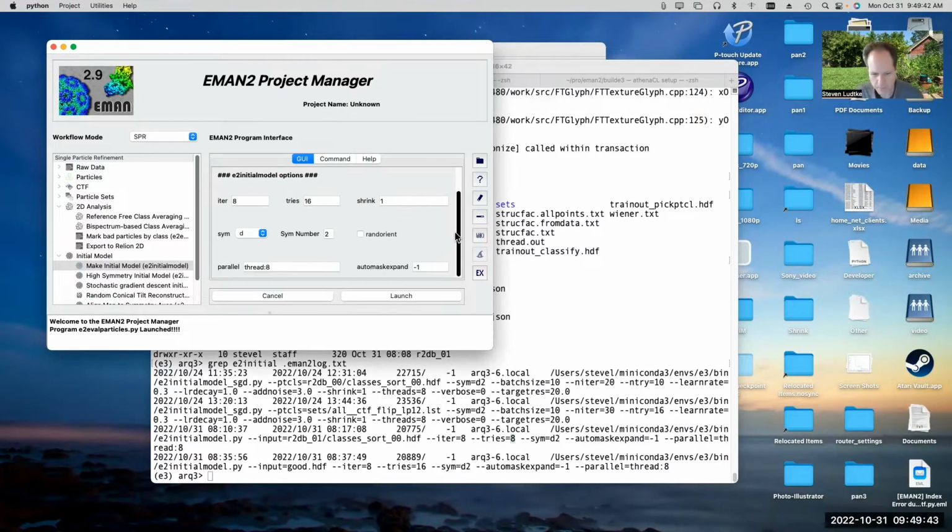Only EMAN2 commands count. Why did you try 16 the second time? I would actually have thought that you would have done it the opposite when you have fewer. Well, the more tries, the better chance that you're going to get a good class average. I probably should have tried 16 up here too, but since I was using a lot more class averages, it was going to take longer to run, and I didn't want to sit around and wait for it. So here I was using a large number of class averages, which makes it run slower. Since I was just doing it as an example, I thought I would run it with fewer. Of course, that means it's less likely to produce a good answer, but anyway.